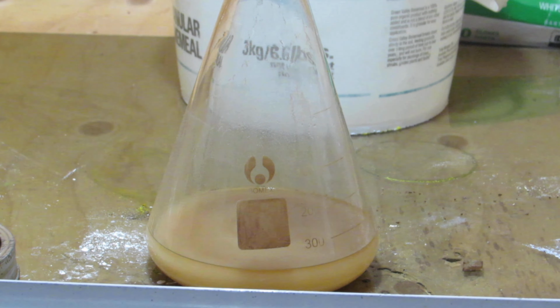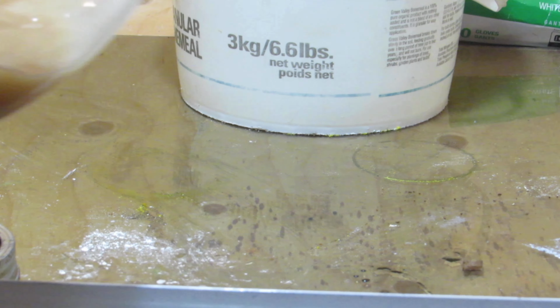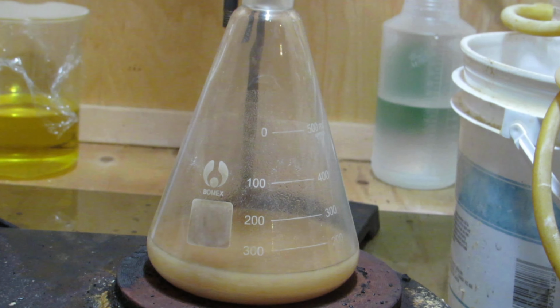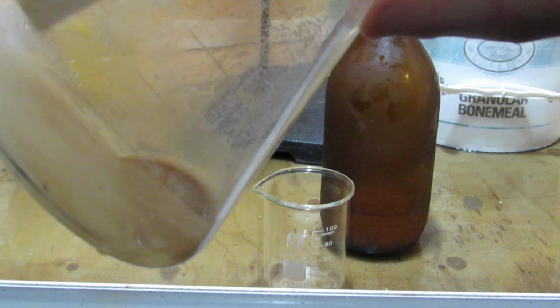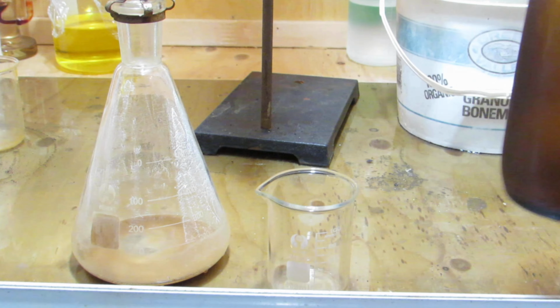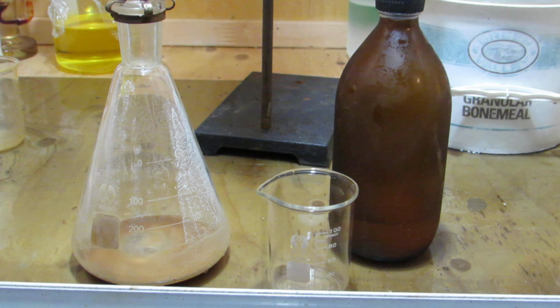After completing the extraction, there are clearly some compounds which were dissolved in the dichloromethane and then precipitated out due to low solubility. Most of the DCM was distilled off of the mixture, and then it was chilled in the fridge. To purify the theobromine from this mixture, diethyl ether will be used, which was produced in a previous video by the acid-catalyzed condensation reaction of ethanol.